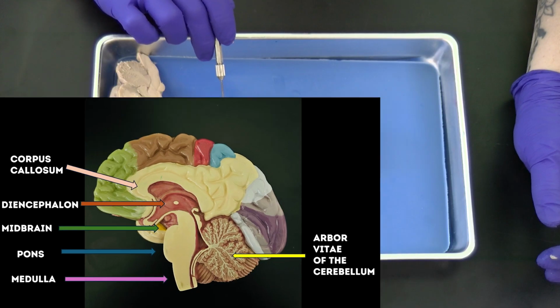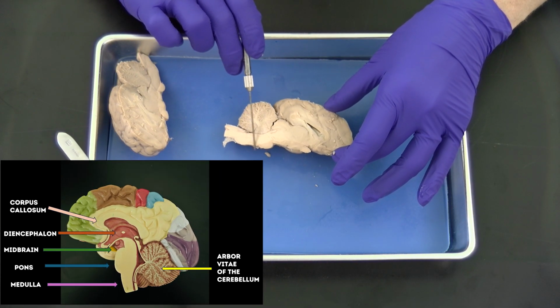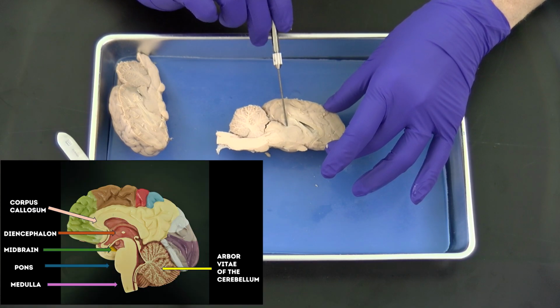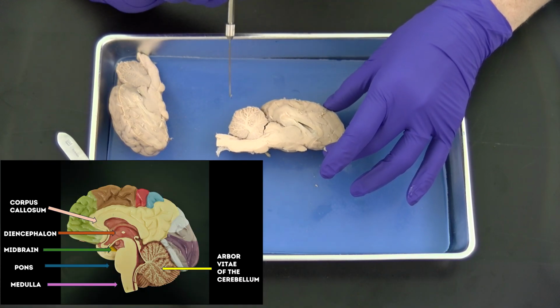So again, spinal cord, medulla, pons, cerebellum, diencephalon. So the cerebellum, you can see, is beautiful when you cut it open.